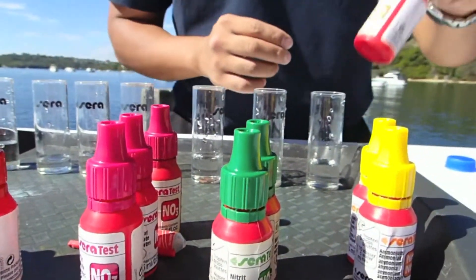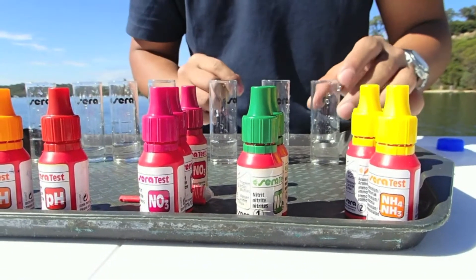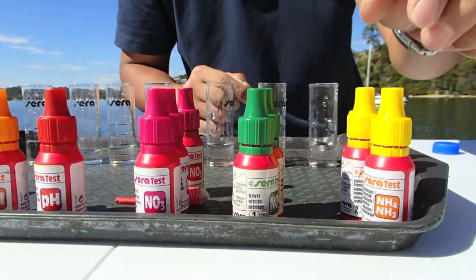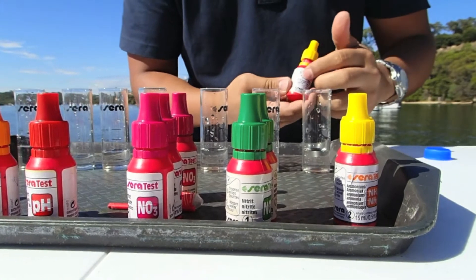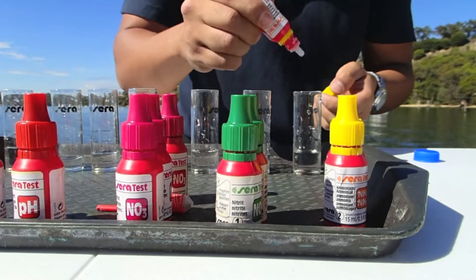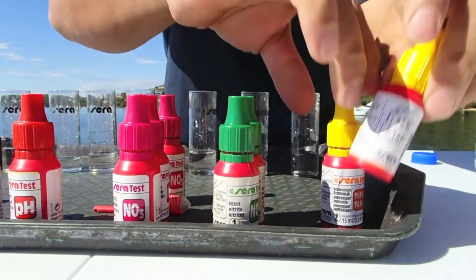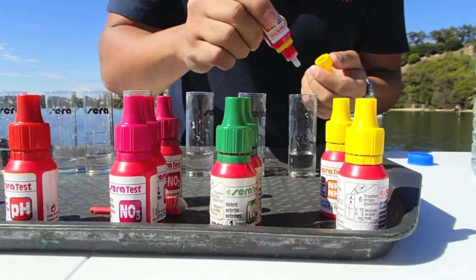So I've chosen this water test kit because I know that it's reliable. I like the jars in that they can stand upright and you can pour water in without it toppling over and having to start again. The other thing is that it's got a little cheat sheet on the bottle. It tells you to fill it to 10ml and drop 6 drops of bottle number 1.